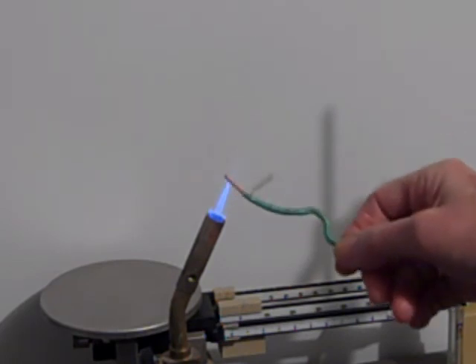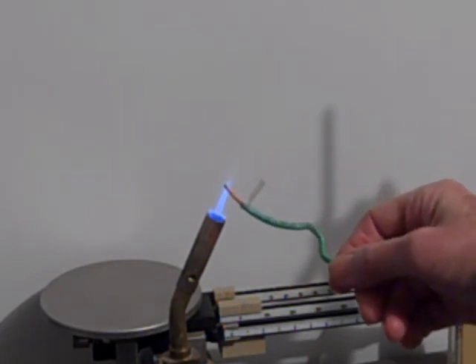Yeah, there you go. Not the green wire. I saw some right at the tip.